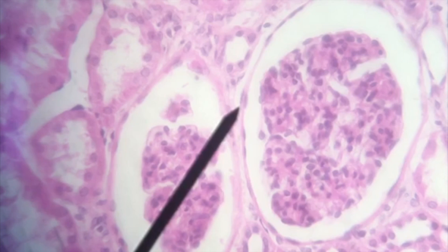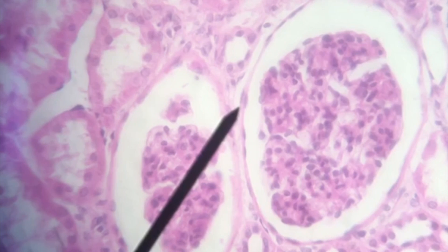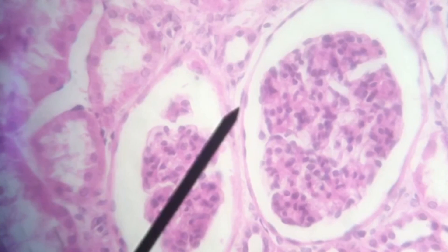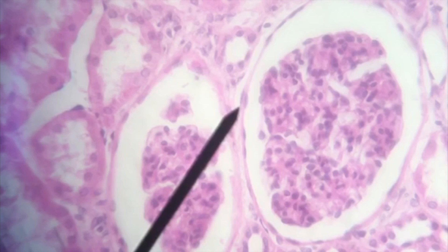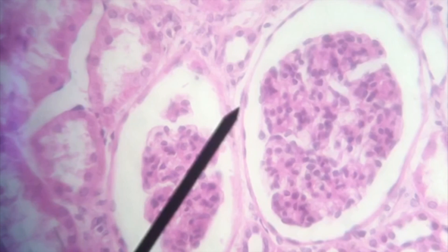This tutorial is going to work through the histology of the different tissues in the human body, including epithelial tissue and the various connective tissues.